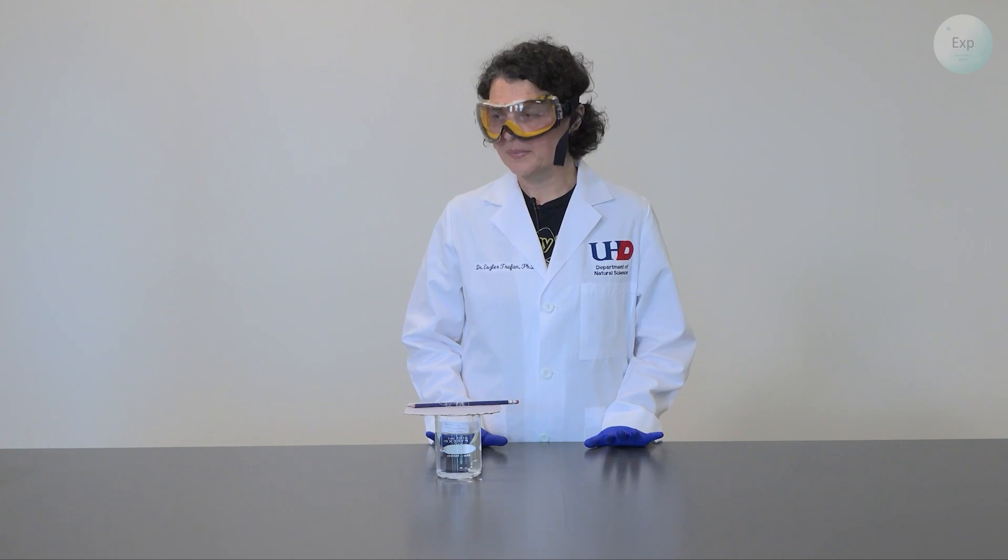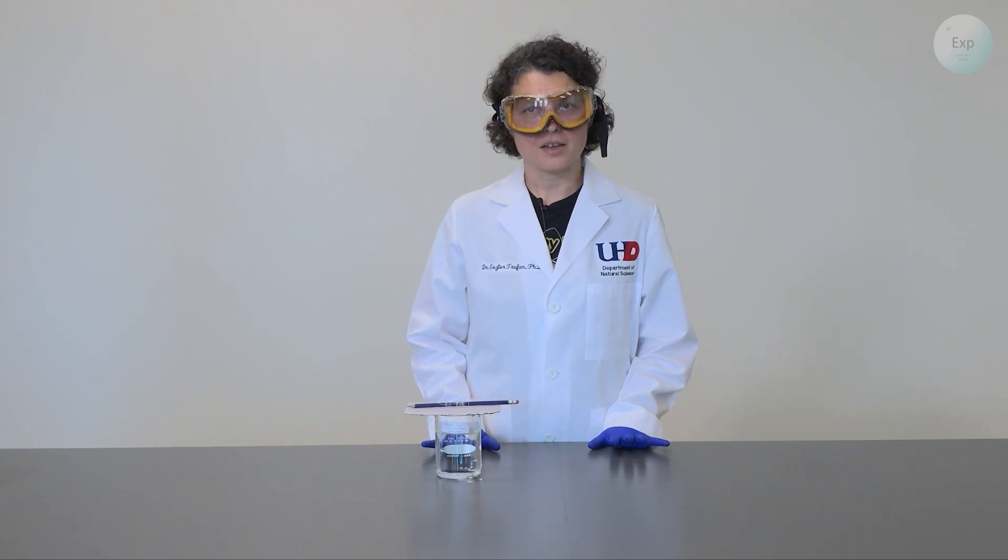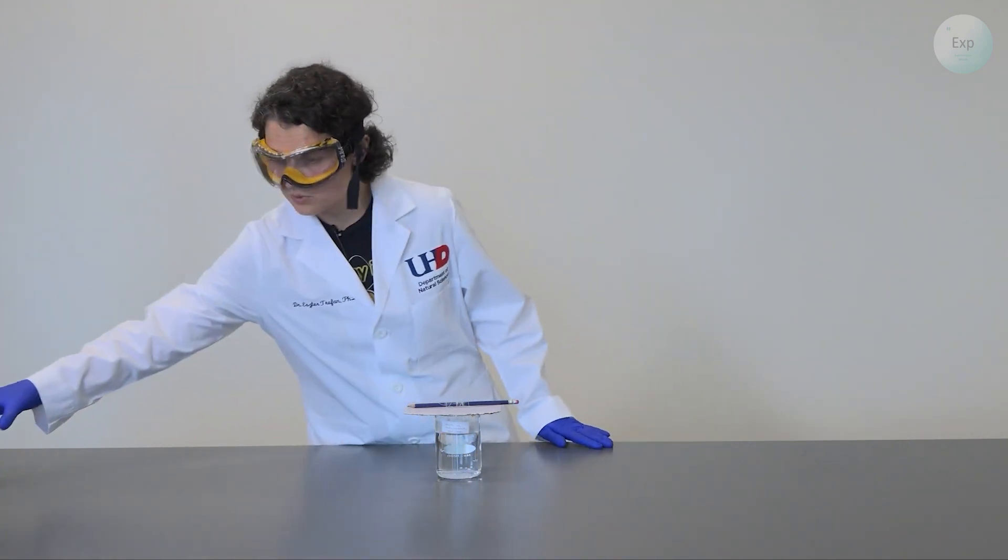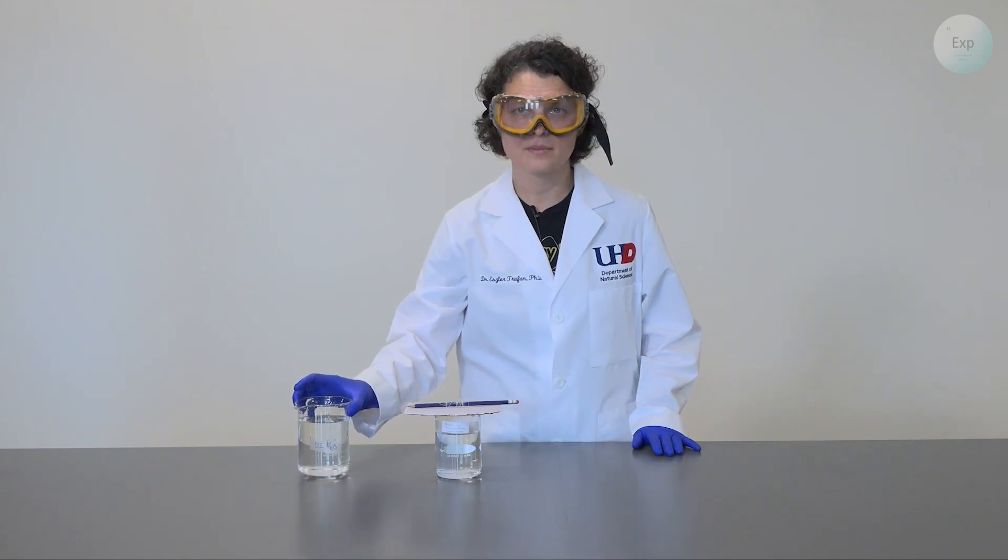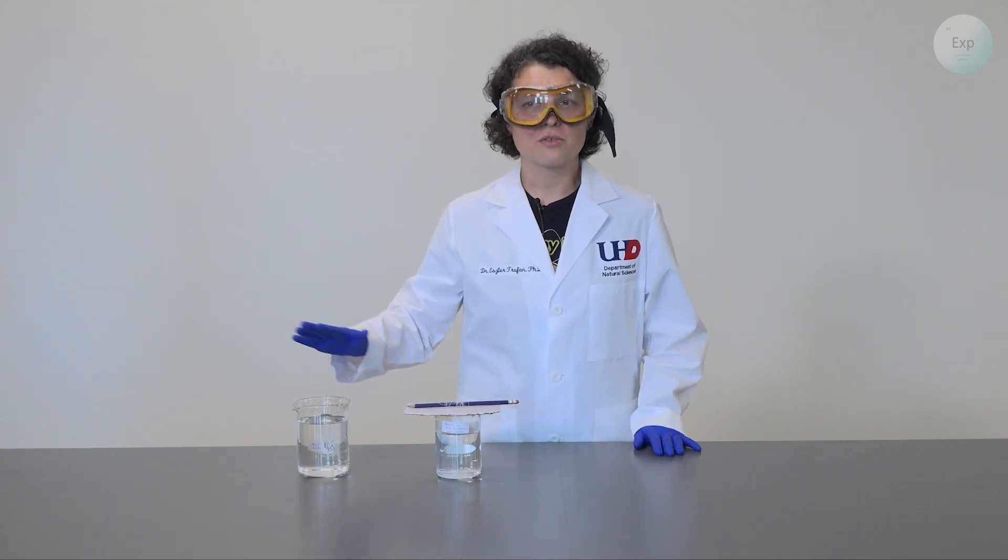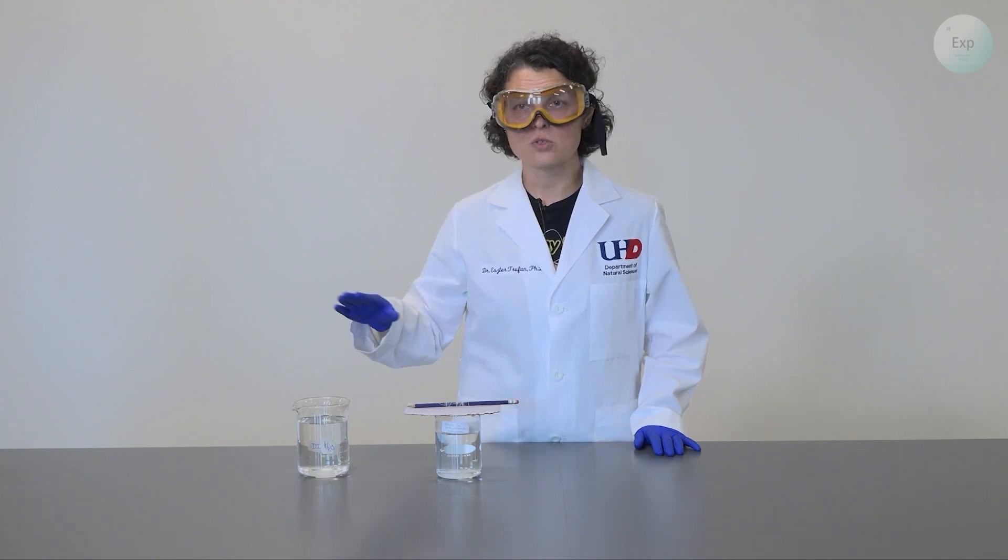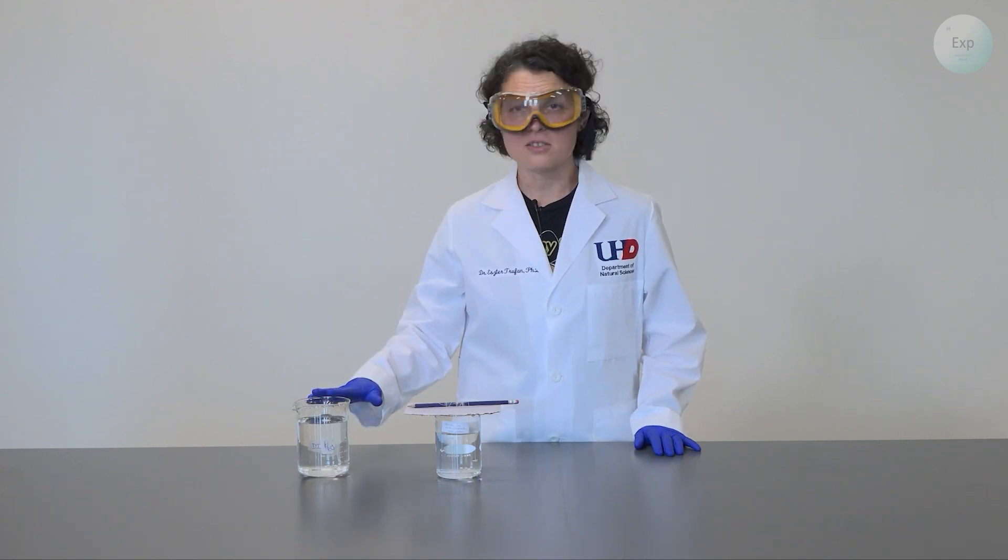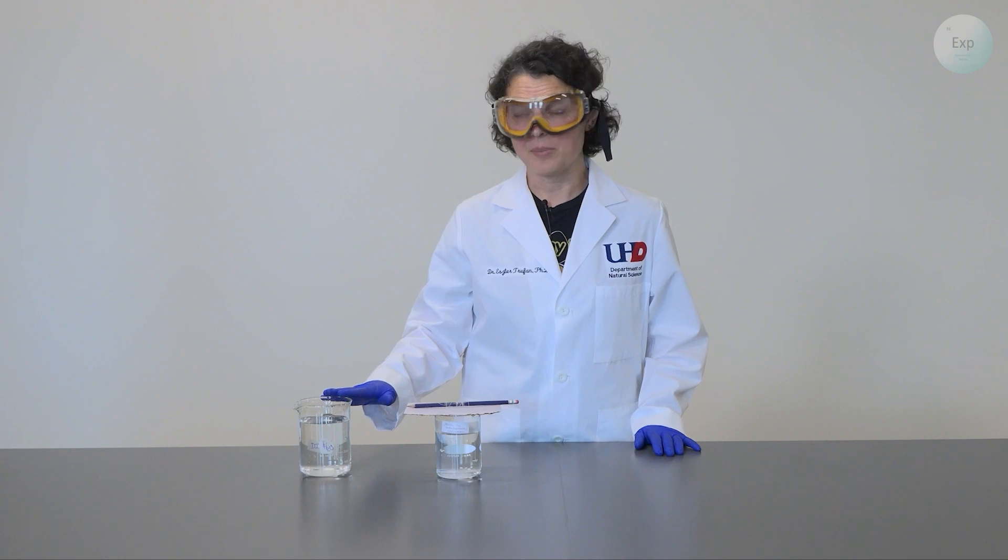So in order to help them out, there are a couple things that we need to do. First, we're going to use some deionized water because every time we remove the solution, we need to rinse the excess solution around them and any dust or particles that they may pick up in the process.